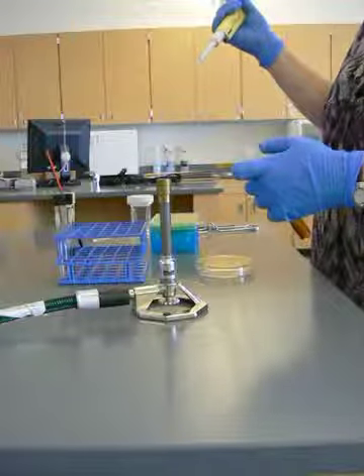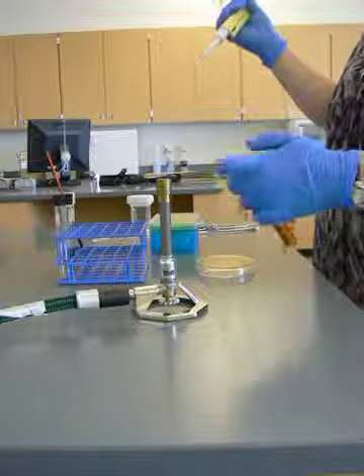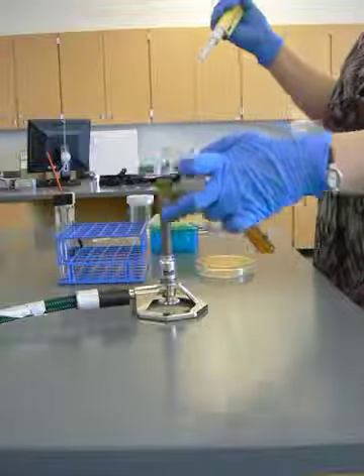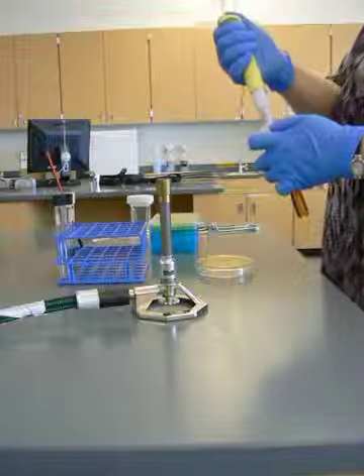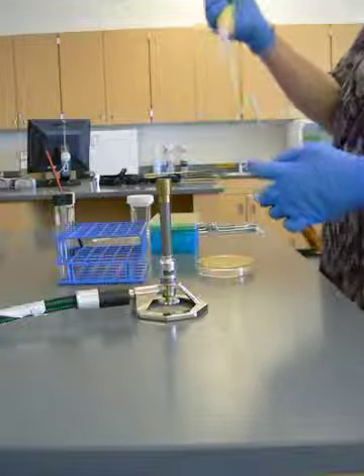Now, because I happen to be able to do this, I'm going to take this off without setting myself on fire, and I'm going to get 10 microliters.